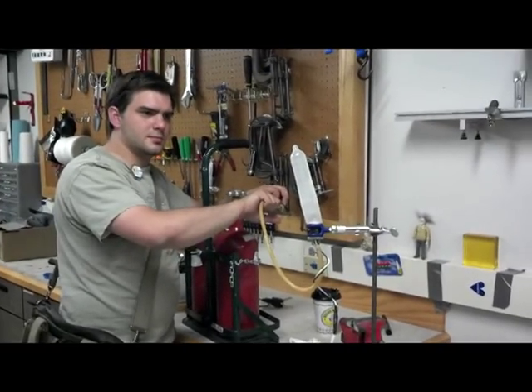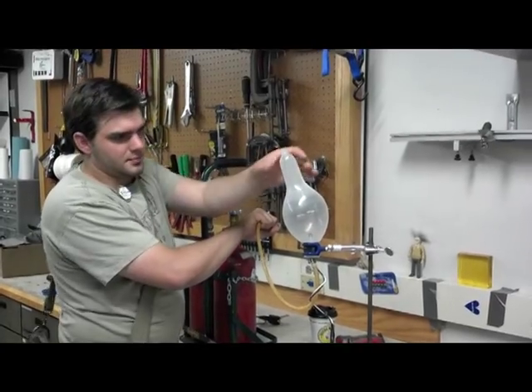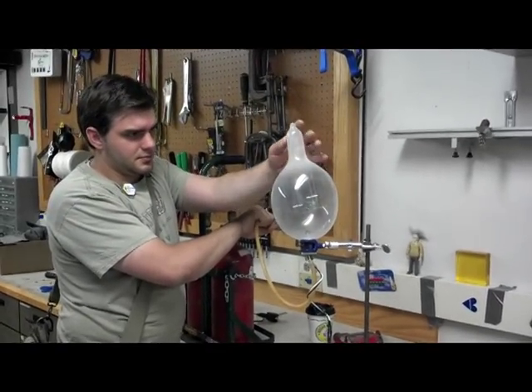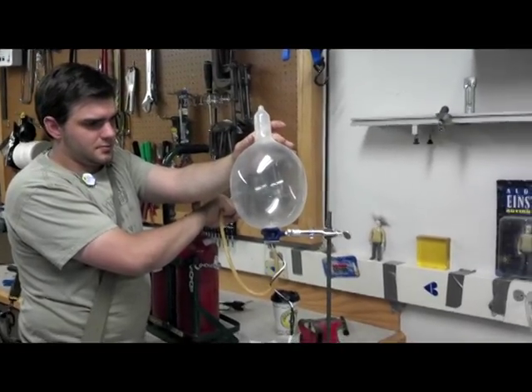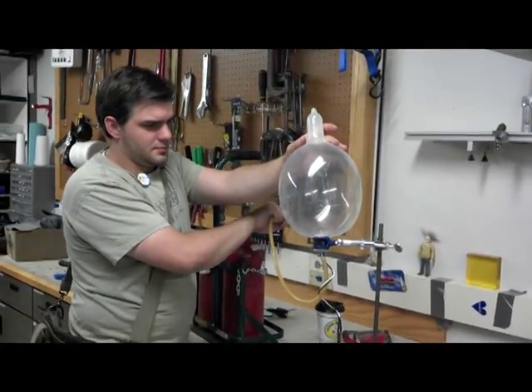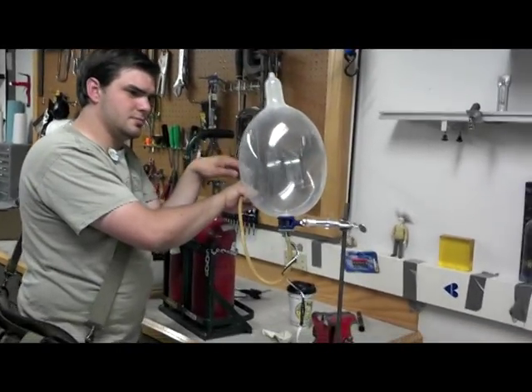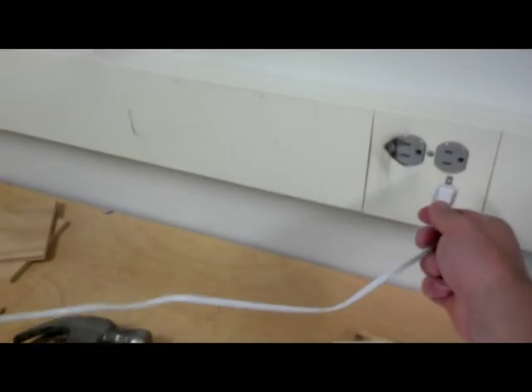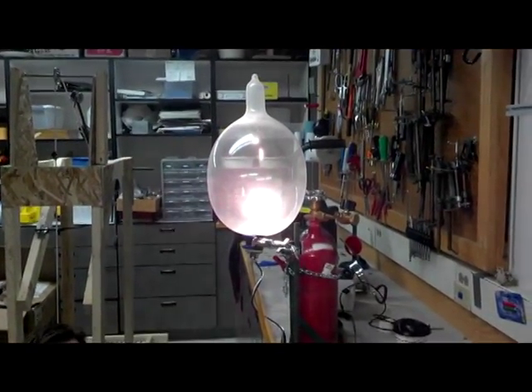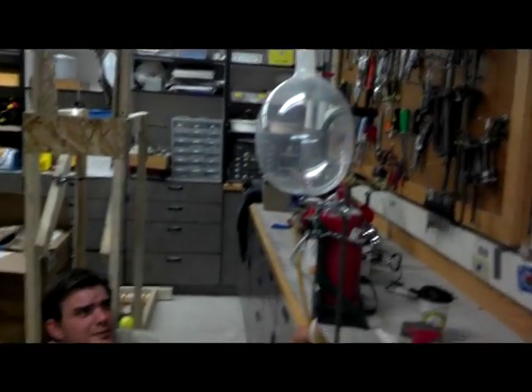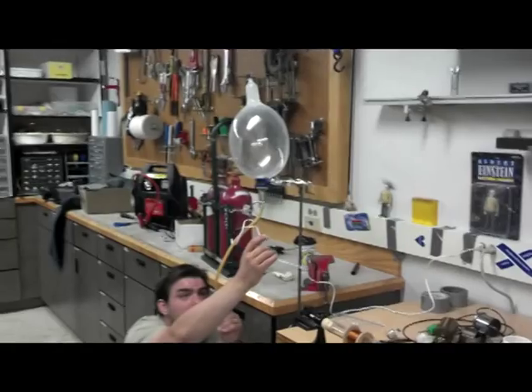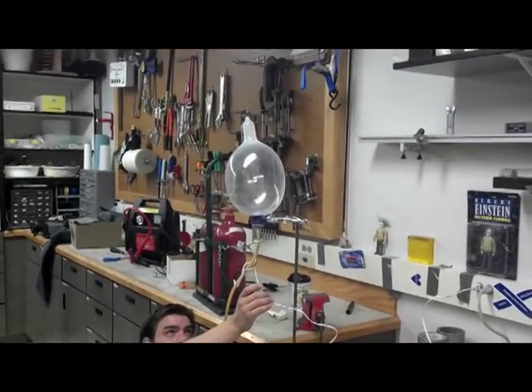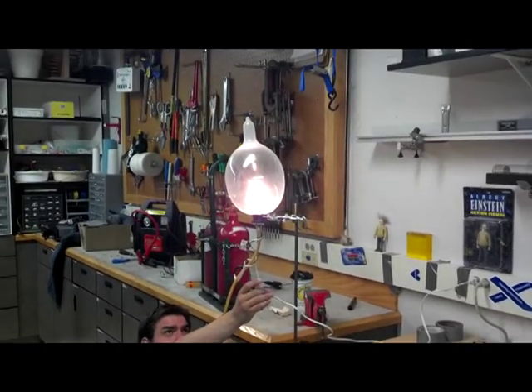Alright. Alright, you ready? Yep. We will plug this in to this wall socket. Good. Let it shrink again. I'm just really nervous about it. Alright, it's recording. It's stretching.